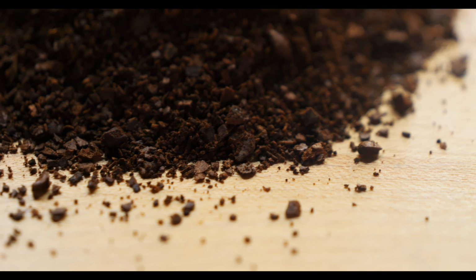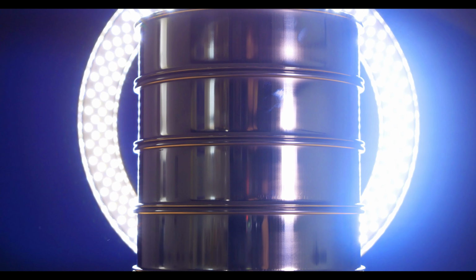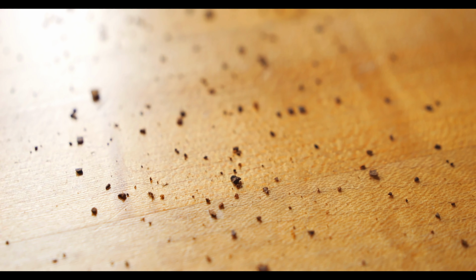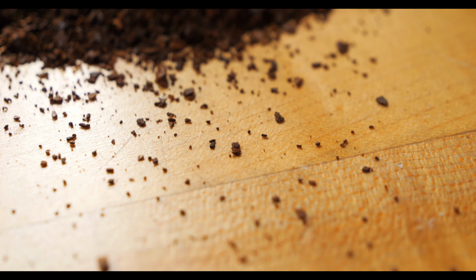Going more in depth though, if you know the bulk of your material is around 50 mesh, your sieve stack could be 40, 45, 50, 60, 70, and the collection pan. And if you know there's very fine particles in your material, lab technicians can replace the 70 sieve with a 200 sieve. But whatever your coffee production process looks like, the concept of designing a sieve stack in step increments yields the most accurate distribution curve.